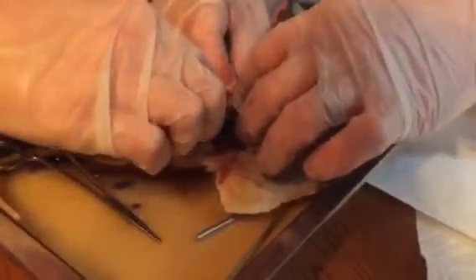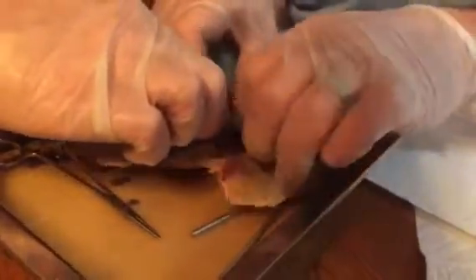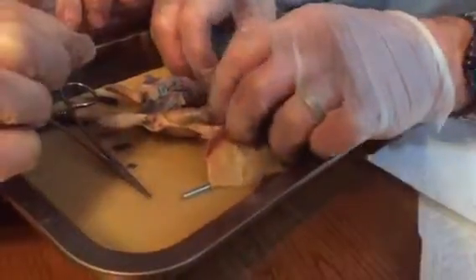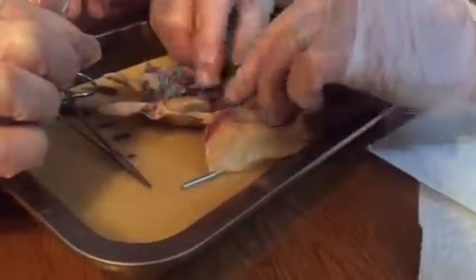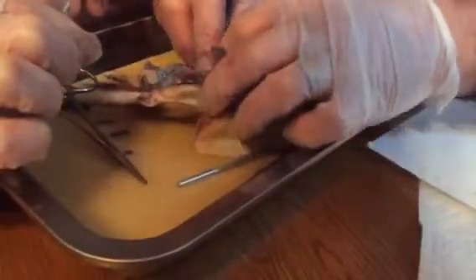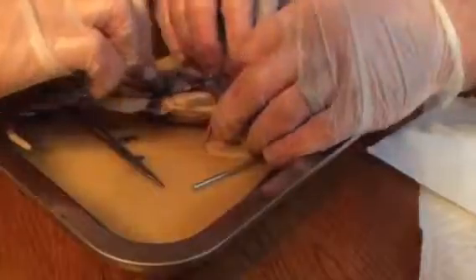So where it comes. They did feed him some. Yeah, there's something in there. There's poop in there, right here, look, right where it connects to the bottom. Yeah, there's some nuggets up here too. So if you follow it backwards, find the end. That's the rectum down there.